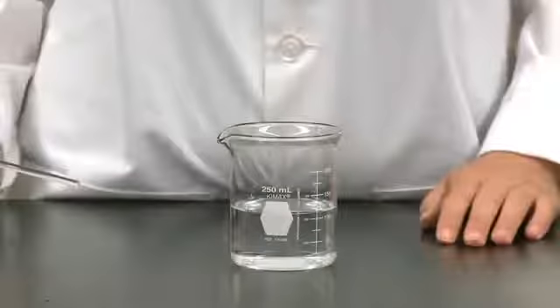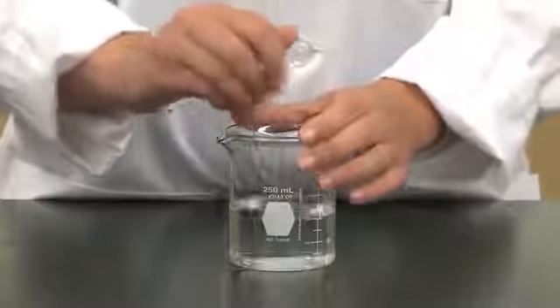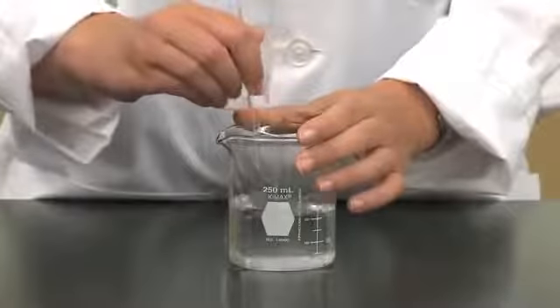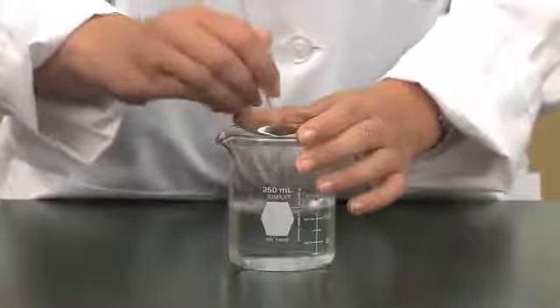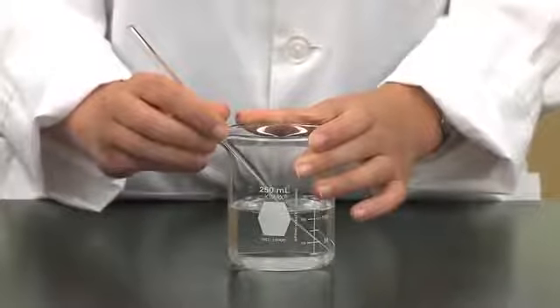You'll now want to dissolve all of your solid into the solvent. To do this, vigorous stirring with a stirring rod should do the trick. Be patient and make sure to dissolve all of the solid because none of it can be left behind before transferring. Make sure never to remove your stirring rod from the solution without rinsing it first, as some of your analyte might be lost.